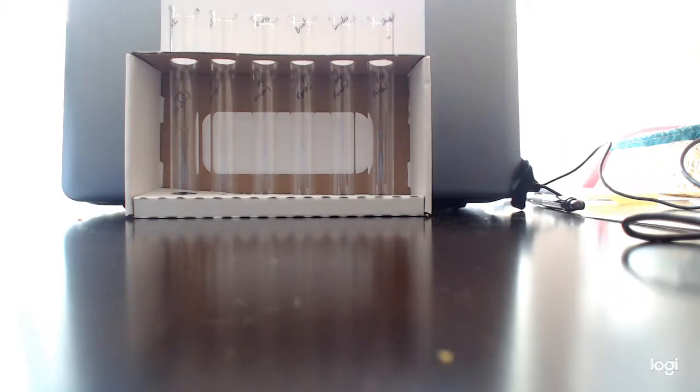And how we're going to get started is first, we're going to put a little bit of water into each of the tubes. Now, the water just serves as a background for the reaction to take place. As you learned in the previous chapter, water is a great substance because it's a molecule that supports life, because lots of things are soluble in it.